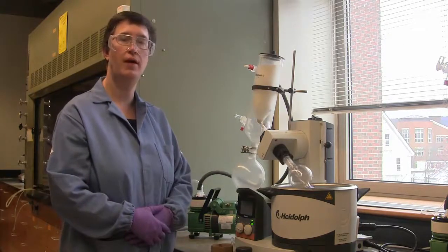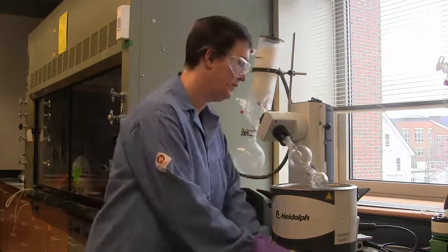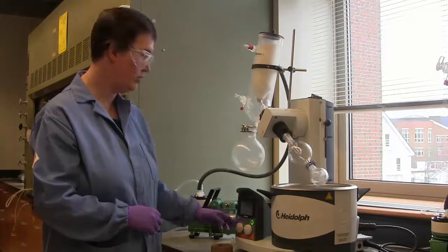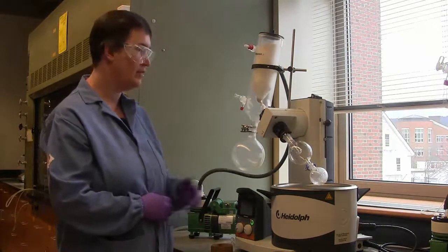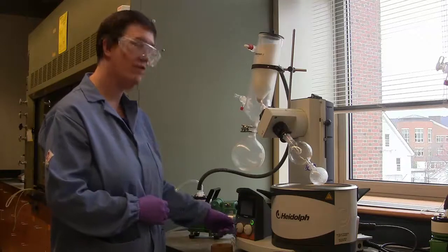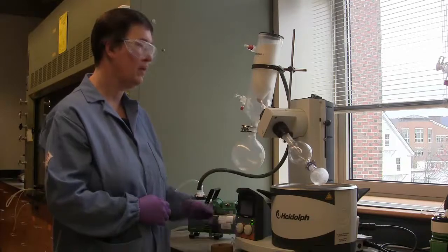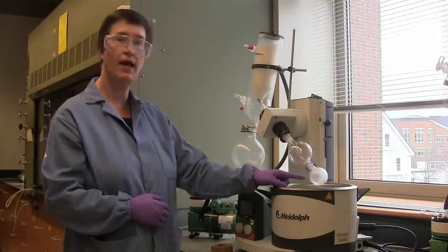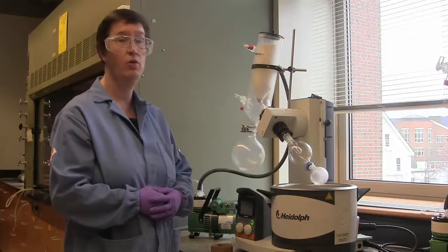When you think evaporation may be complete, you can lift your flask up out of the water bath and take a look. It's usually easy to tell whether or not evaporation is complete if you stop the rotation. And what I usually do is allow the flask to sit still for about 10 or 15 seconds, and I look for boiling in the flask. If I don't see boiling, I will begin to rotate slowly and look for evidence of evaporation of material out of the round bottom flask. In my case, I'm getting condensate on the round bottom flask, which tells me I'm absolutely not finished with the evaporation process.